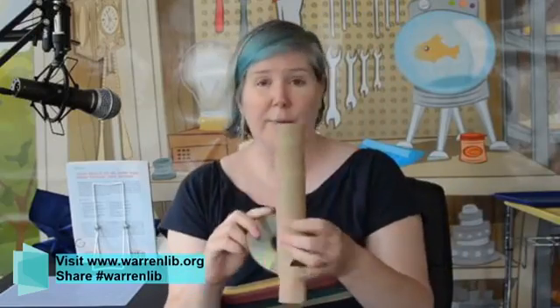You're going to need a pair of scissors, okay? A good sharp pair of scissors, or get your parents' help. You might also have one of these. This is called a Canary Cutter. And they're a little serrated blade, but they're safe, so they can help sometimes with cutting details. And then you may decide that you want a bit of tape. And if you want to be really careful, you may want a ruler and a pencil. So that's all the supplies you need for this one. It's really simple. And as you can see, I didn't even tape mine in, and it works absolutely fine.